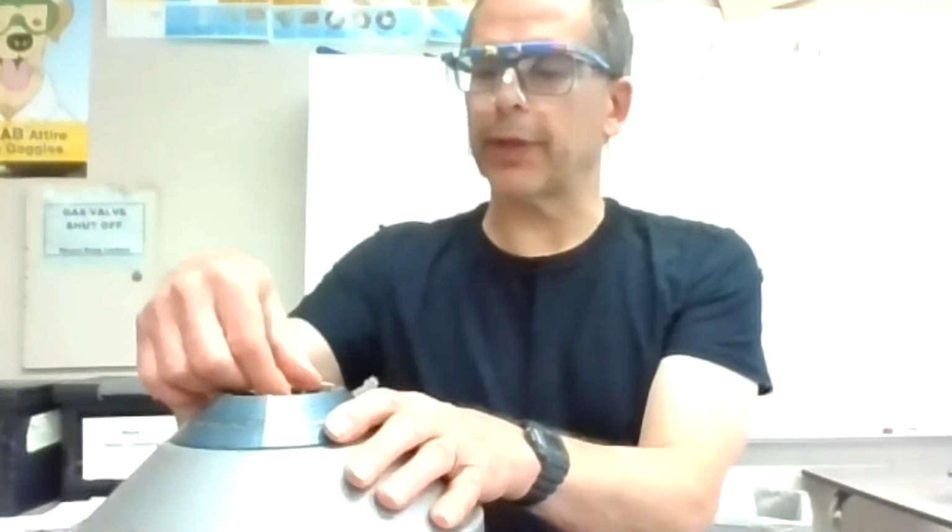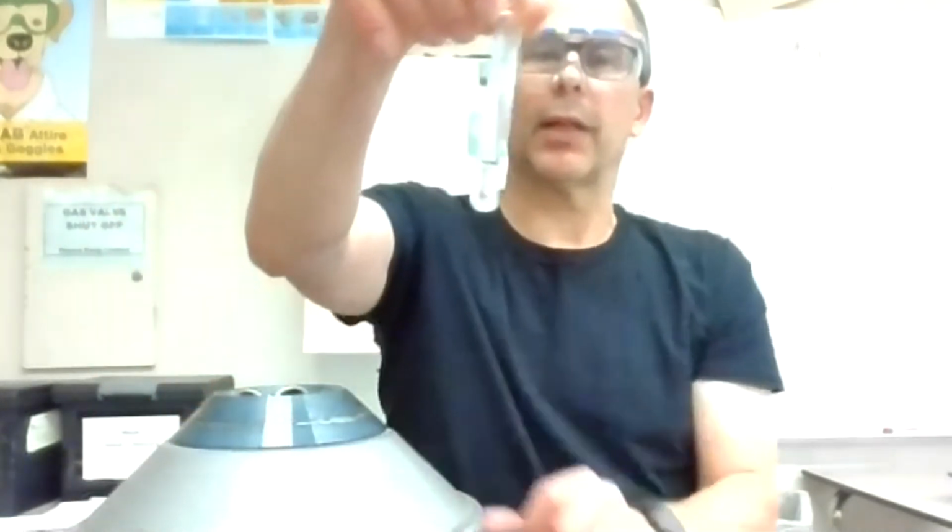Next thing I'm going to add is CrO4 minus 2, so I'll get that ready. I still want to keep this in here, spinning around a little bit so we get a good separation. All right, I'm going to slow this down. Hopefully it's separated okay. Ooh, I like that.